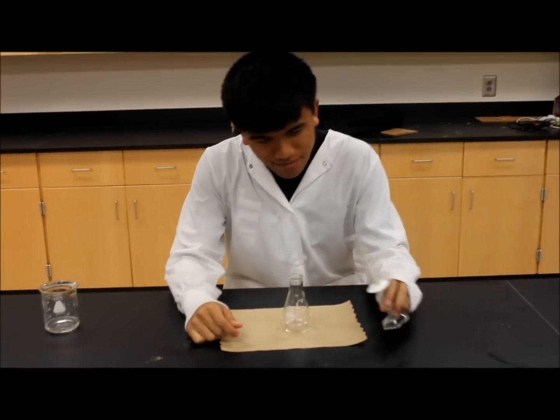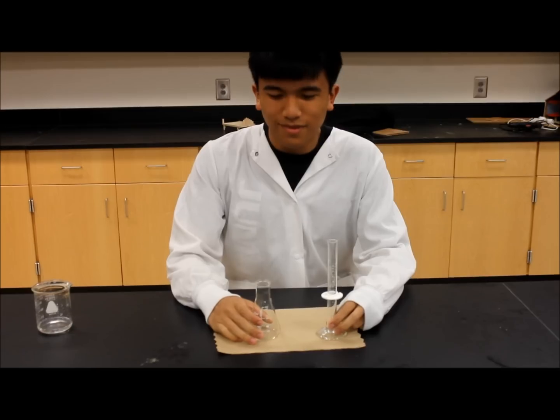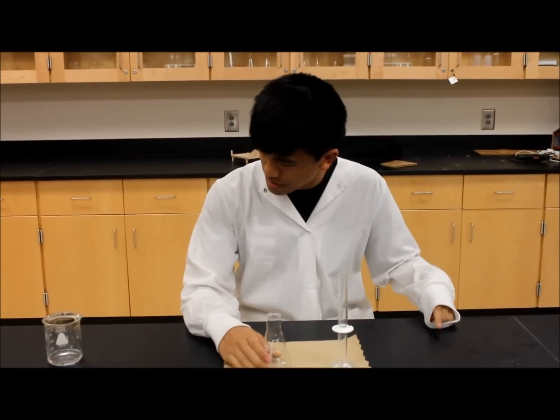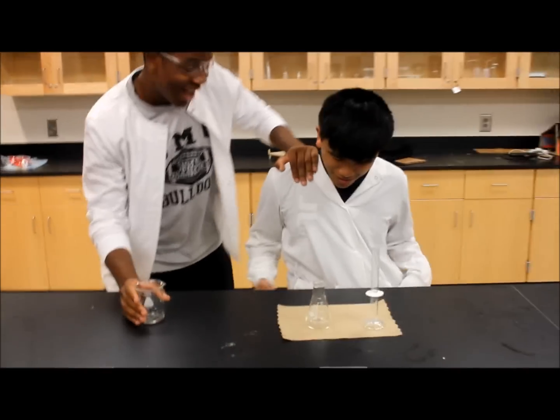Rule number three, always wear your safety goggles. Dude, where are my goggles? Where am I putting them somewhere? Hey man, forgot your goggles!